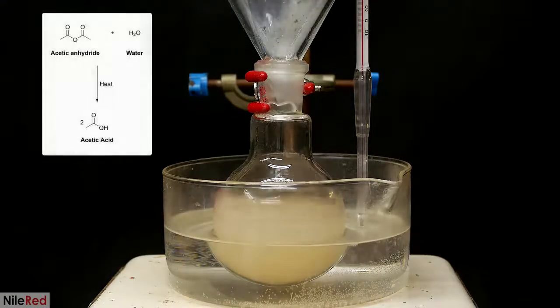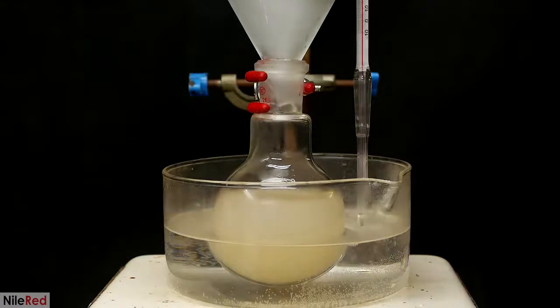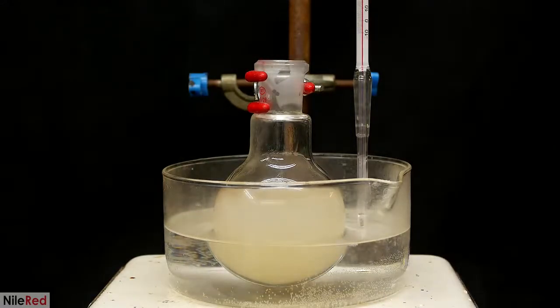The other 20% of this is just water, and up until this point, everything was completely water-free. The purpose of adding it now is to destroy any excess acetic anhydride that remains after the reaction. I can't just add pure water here because it could cause the cellulose triacetate to fall out of solution. If enough falls out, the whole solution could freeze, and this step could get messed up. The extra acetic acid just helps to keep everything dissolved.